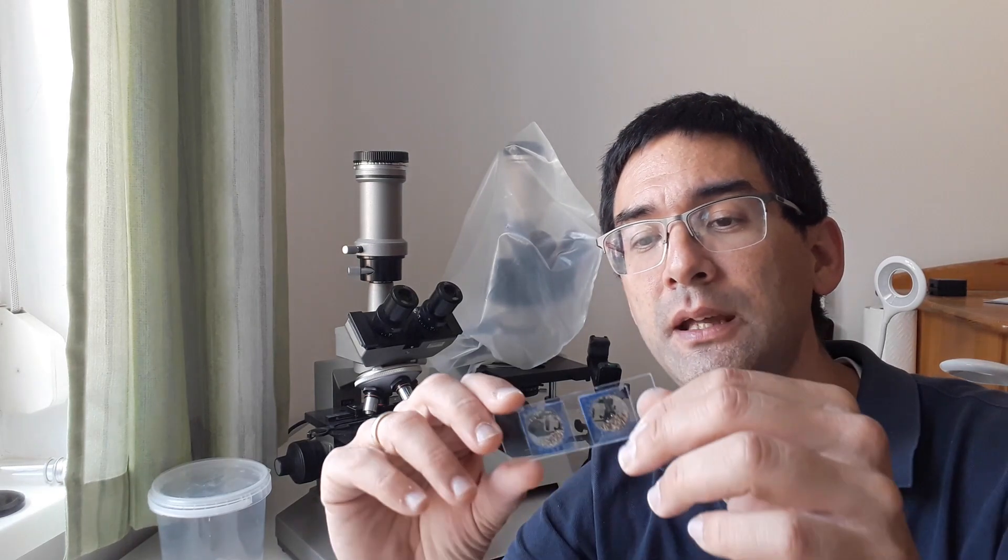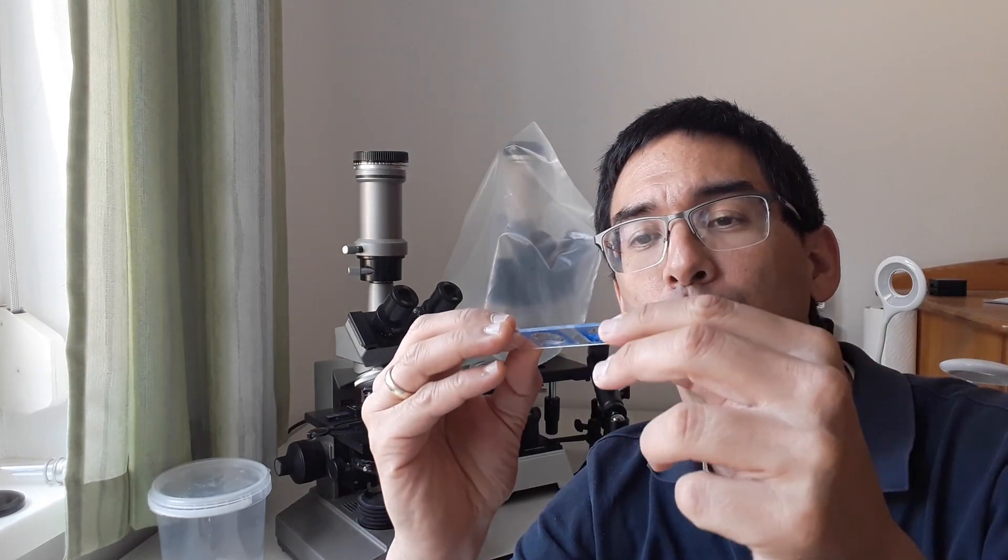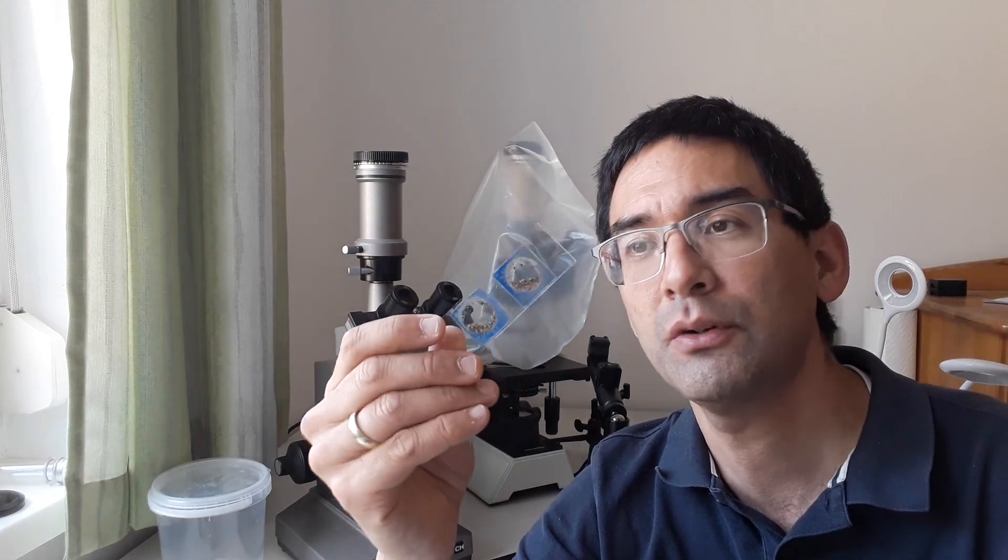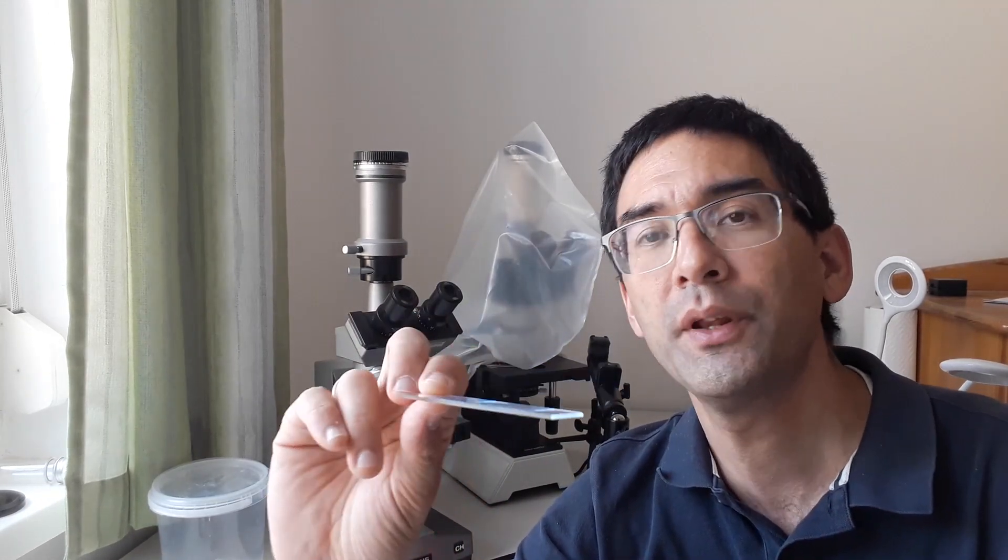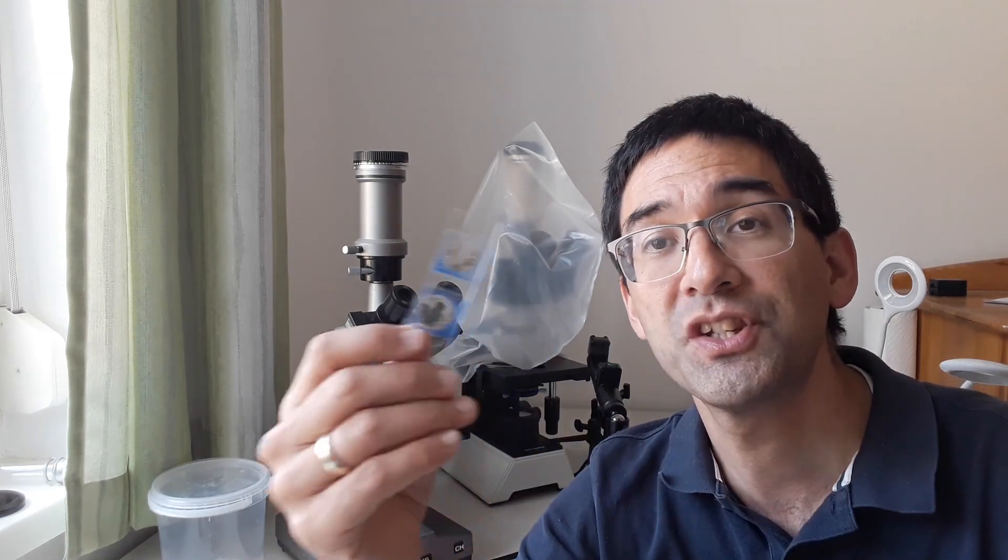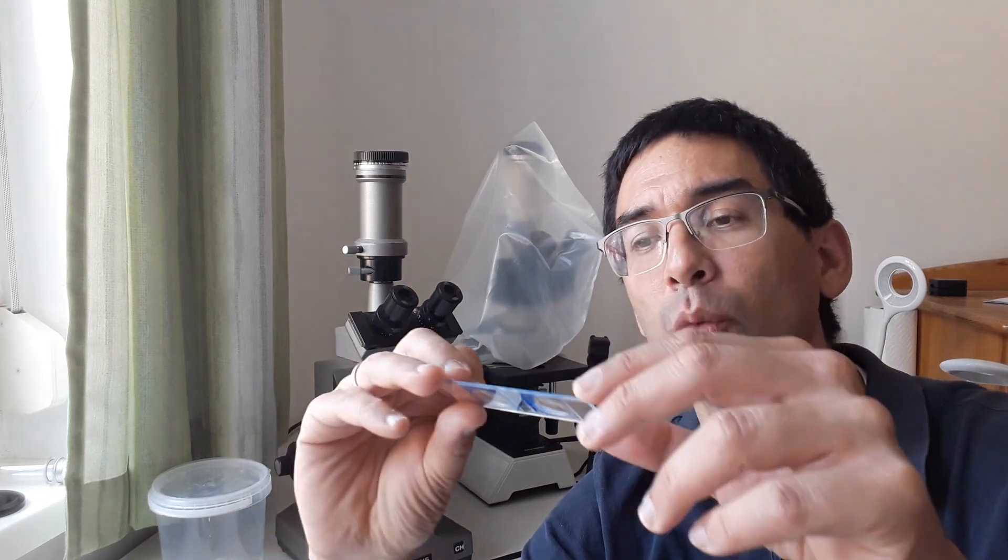But under certain circumstances, maybe it's a good idea not to use any mounting medium at all. Here, for example, I have a dry mounted permanent slide of sand, because I want to be able to shake it around a little bit and observe the sand in a very natural way without it being modified by a mounting medium. For stereo microscopy, that's actually a pretty good thing. What I'll be doing is showing you a couple of methods.